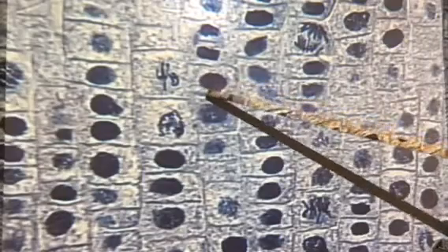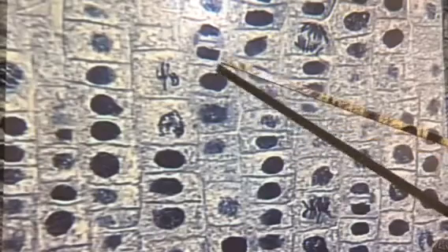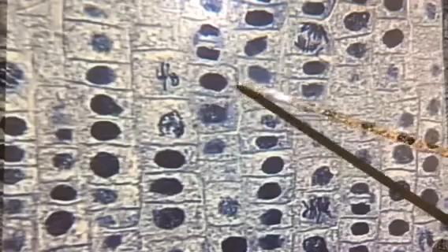When we look at the nucleus, it's all unwound DNA. It hasn't formed chromosomes yet. So this cell is just living its life, being an onion root tip cell, doing all the functions that it needs to do to be an onion root tip cell. Most of its days of life are going to be spent in this category right here, which we call interphase. Then, at some point in time, it's going to say, I'm going to divide for growth or repair.